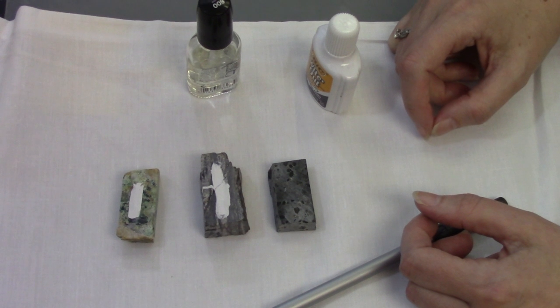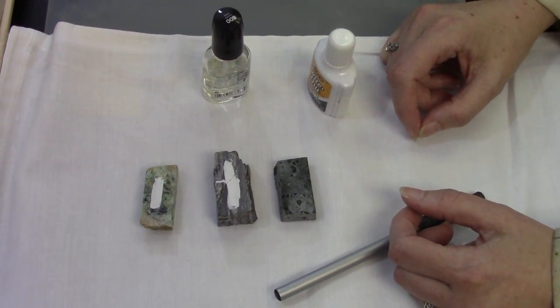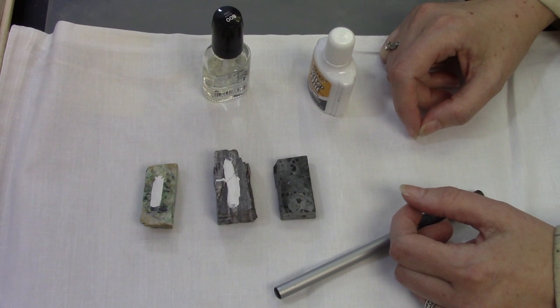Also, if you ever need to come back and make more thin sections, you'll be able to find the same rock sample that they came from.